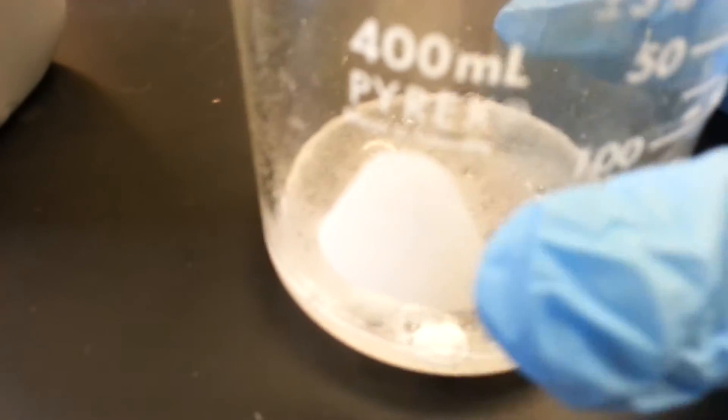You'll notice if you do this experiment—you can probably tell there's some liquid on the side, and it's getting warm because it's releasing heat.